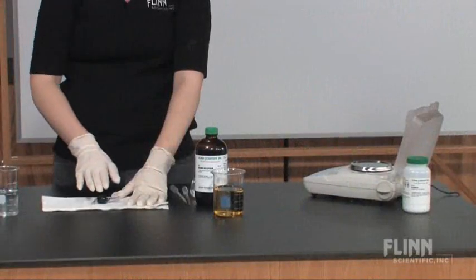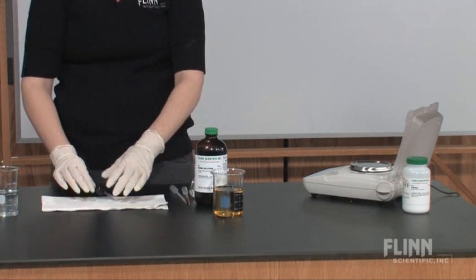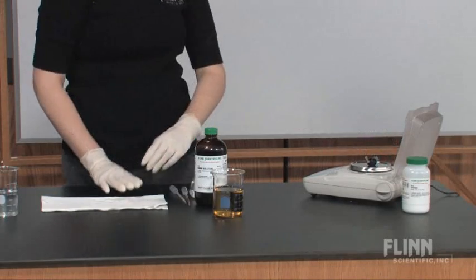Now let's look at the results of our osmosis test. If water molecules diffused into or out of the model cell, the mass of the bag should change. Did it?